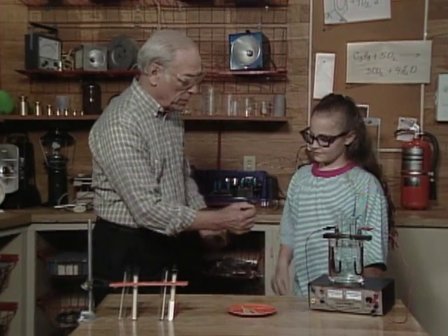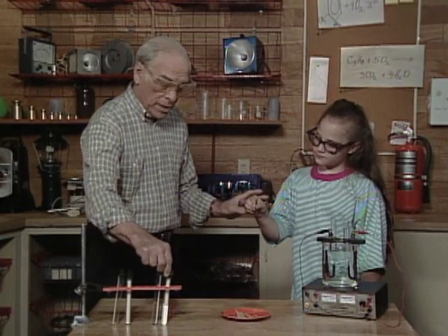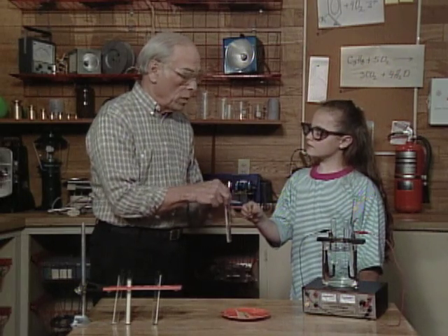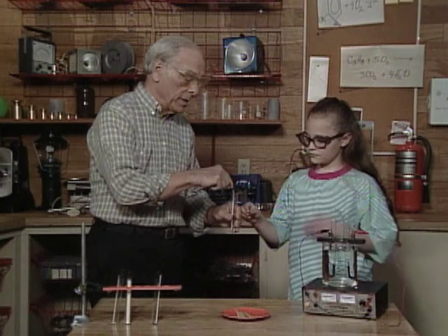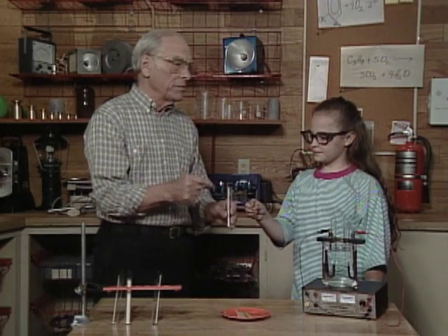Now there's a chemical test for both hydrogen and oxygen, and it's kind of tricky. Here's what we're going to do: you take this little splint and I will light it. Then when I bring this test tube over here, you blow it out and let it glow, and then you put the glowing splint down into — don't touch the liquid, just put it up on top.